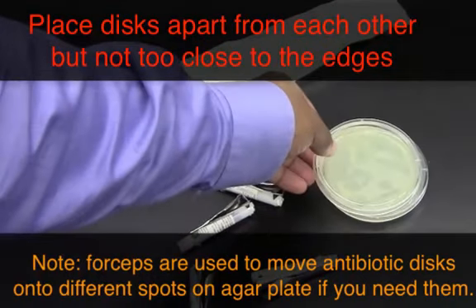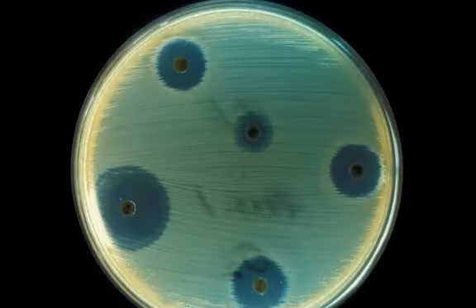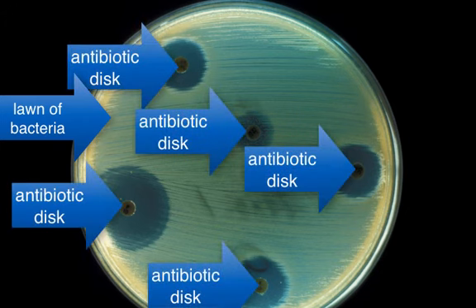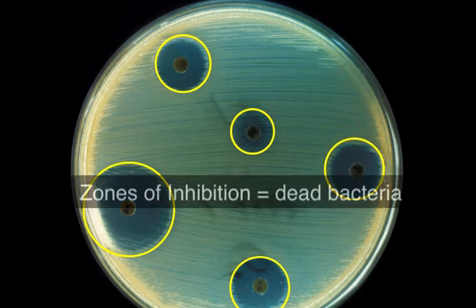And then what we're going to do is measure something called the zone of inhibition. Let's look at some sample results. So we see this petri dish with bacteria growing all over it. Then we have our antibiotic discs. And you see these circles around the antibiotic discs are sort of like dead zones. We call those zones of inhibition.